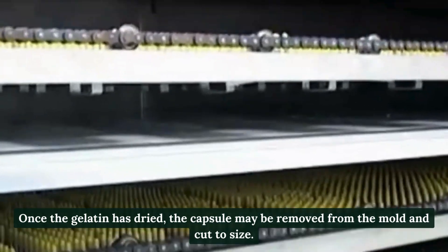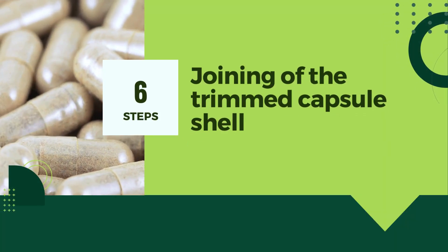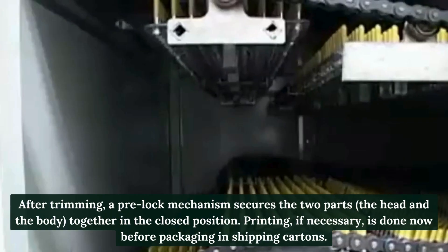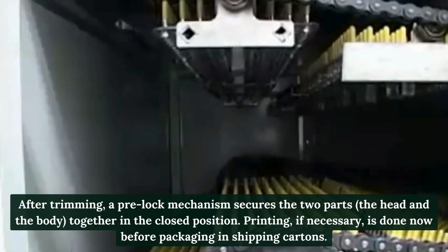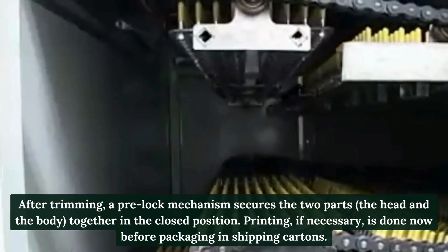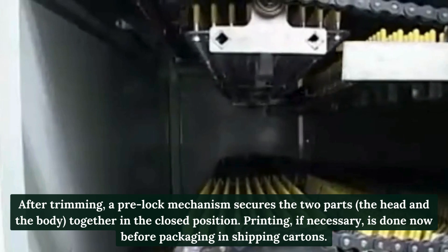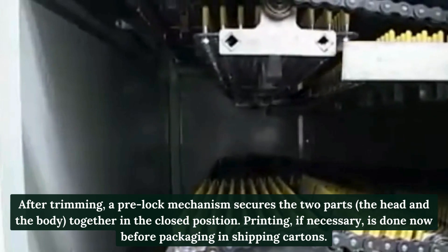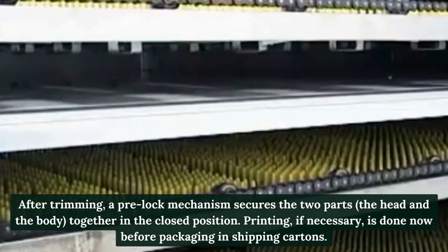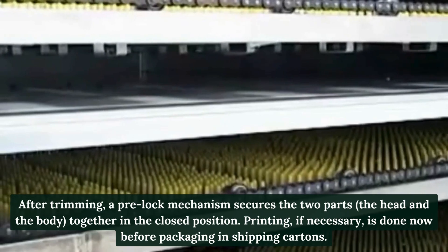Step 6: Joining of the trimmed capsule shell. After trimming, a pre-lock mechanism secures the two parts — the head and the body — together in the closed position. Printing, if necessary, is done at this stage before packaging in shipping cartons.